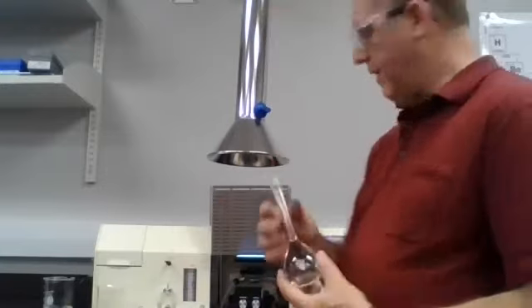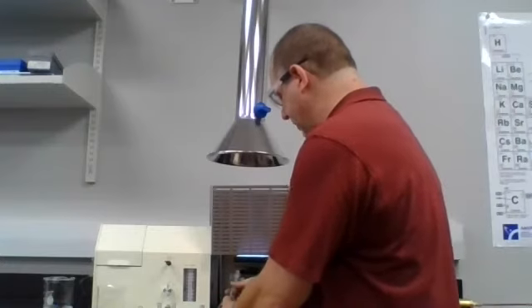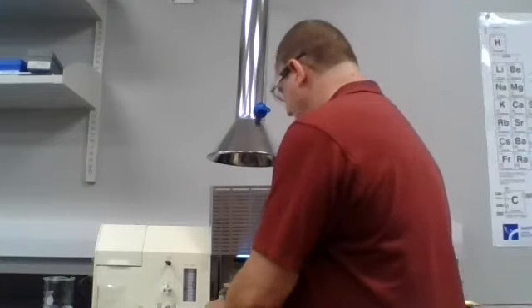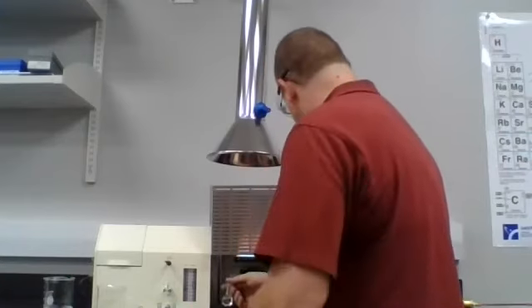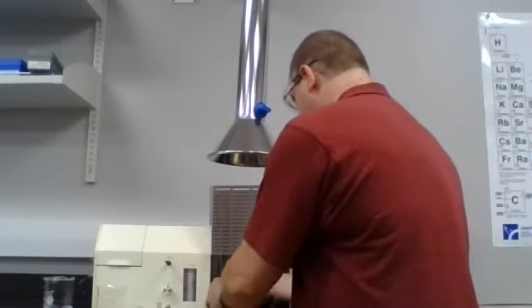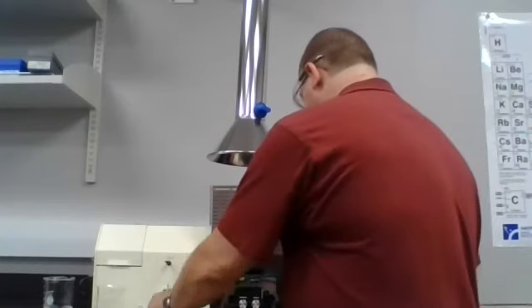The iron, if I measure it, I'm going to find that it ends up at a 0.073. The 5 is going to measure at a 0.180. The 4 measures at 0.130.